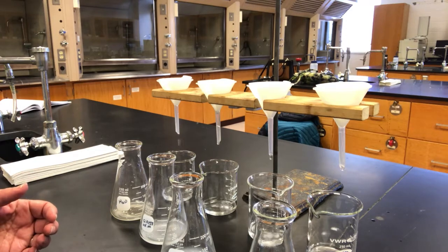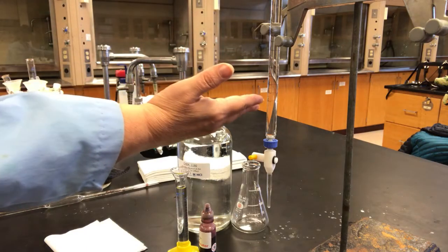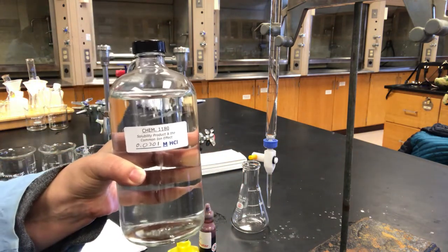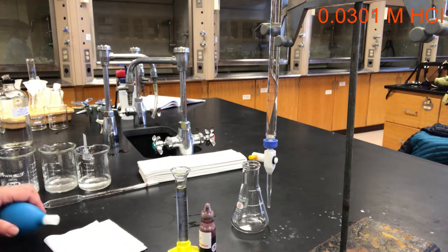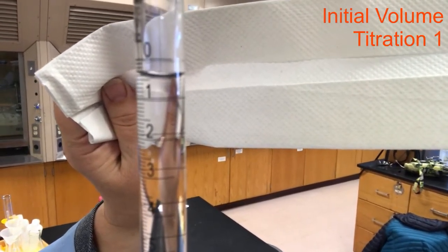Okay, now we're ready to quantify the dissolved hydroxide that went into our solutions. I've set up a burette here filled with hydrochloric acid. The hydrochloric acid has the molarity you see here. And I rinsed it 3 times through and then filled it up, but I haven't read it yet. That's your job. And we're ready to go.